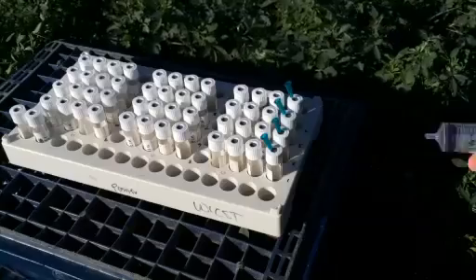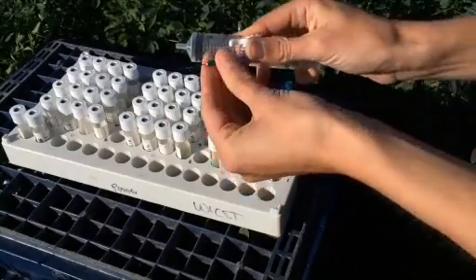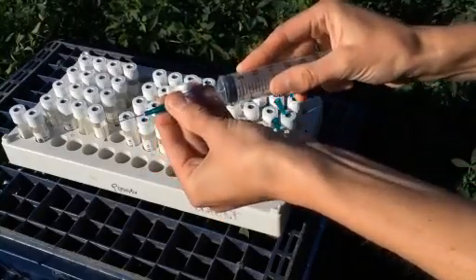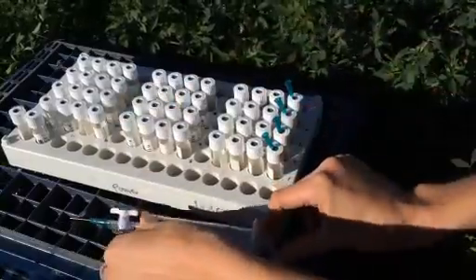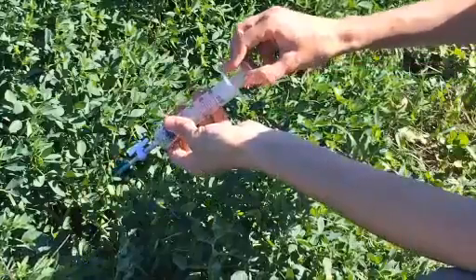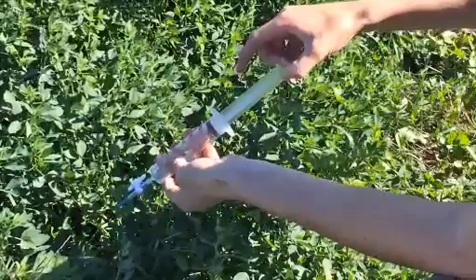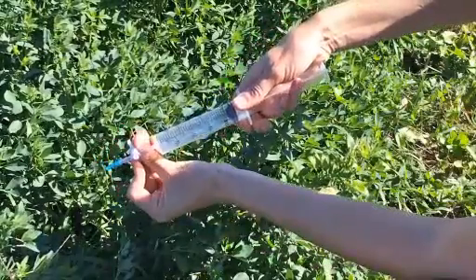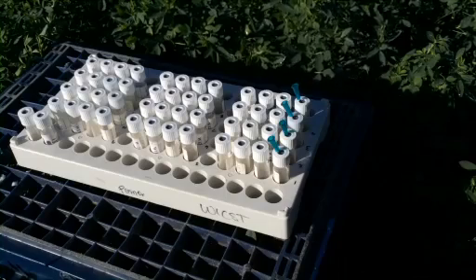With an empty 30ml syringe fitted with a needle and stopcock in the open position, draw a 30ml sample of air from a location adjacent to the chamber at the approximate height of the chamber top and close the stopcock.